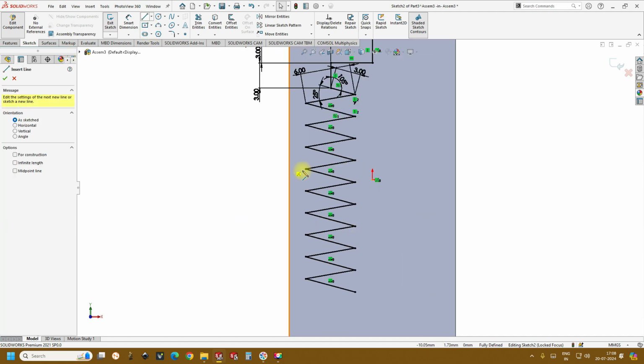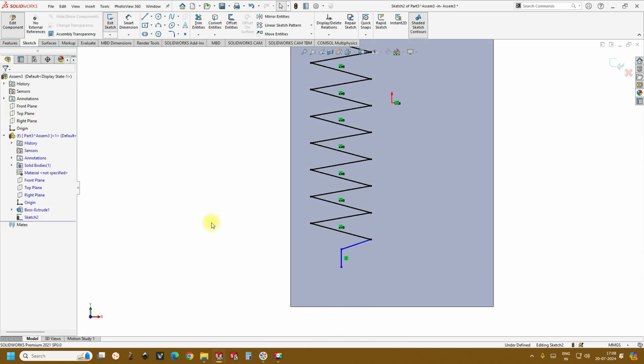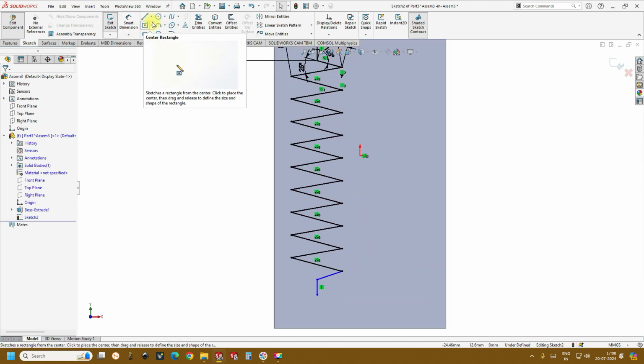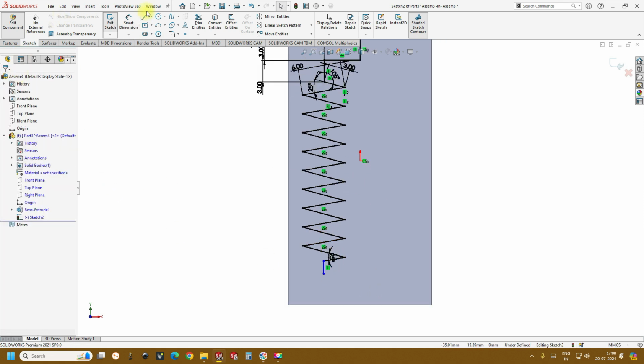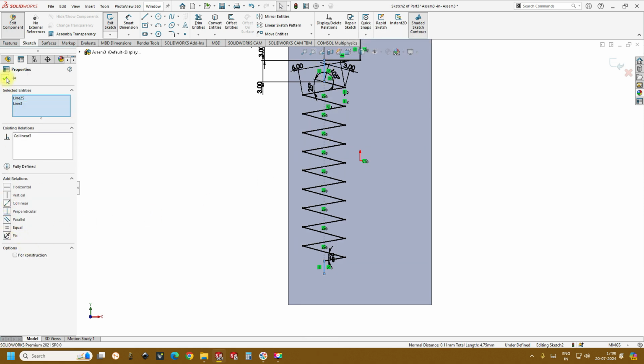Once it is there, the next thing is to create another end line and a straight line, because we wanted to give the sample input and then split it. Once it goes through mixing, we can collect it in an outlet. Okay, so we'll keep this dimension as again 25, followed by just hold control, press this, hold control and select this line and make collinear.